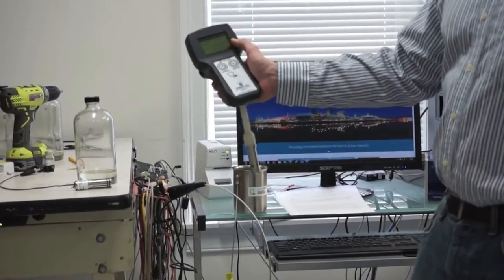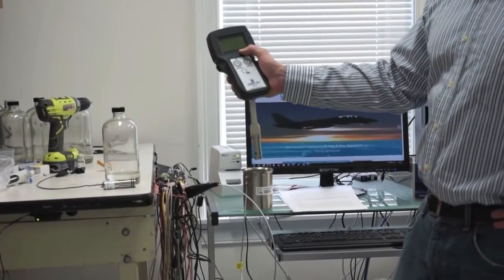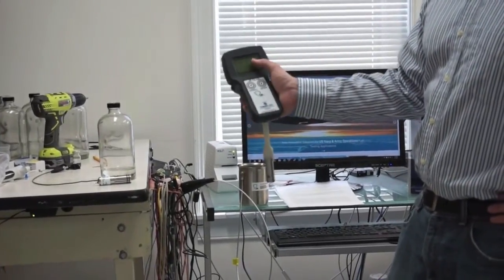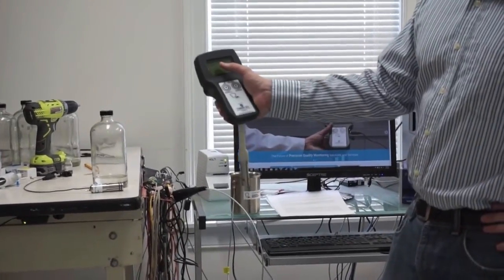You can see here the result is 0.0 picosiemens per meter with 21.6 degrees Celsius. It also gives you a date stamp and a time stamp at that position.